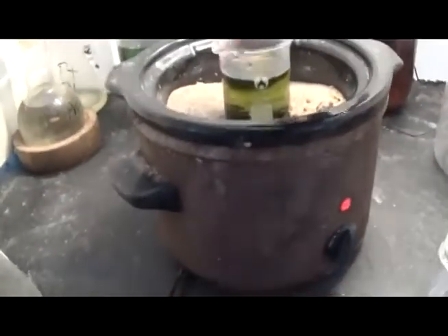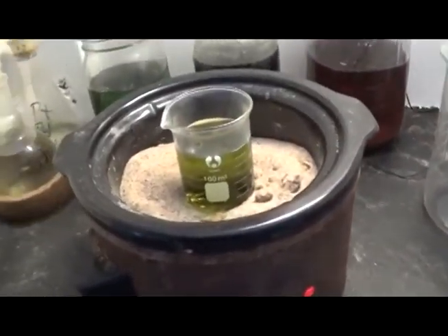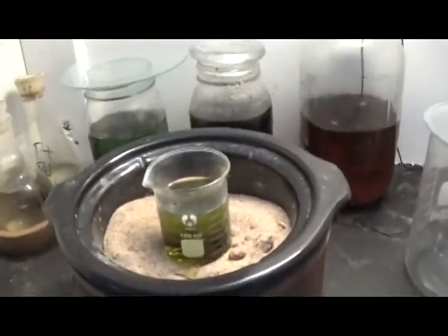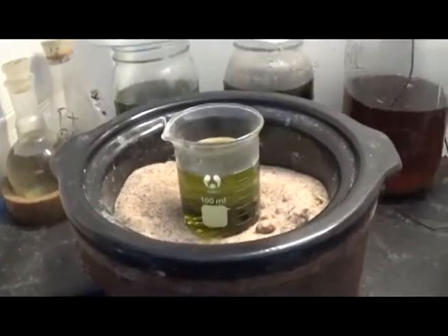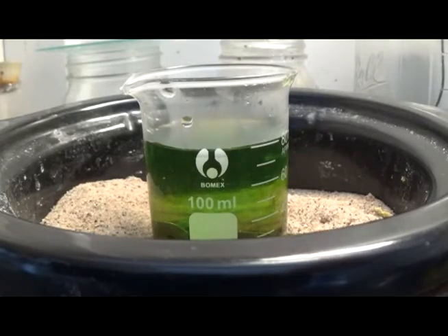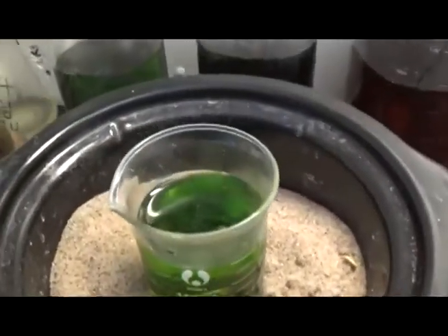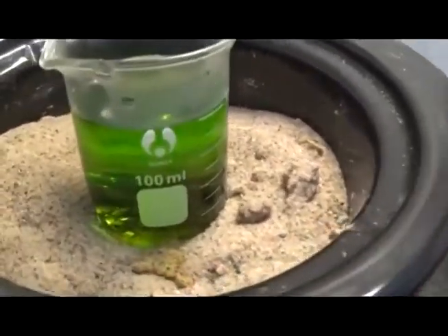Actually, a little bit of a promising start here — it does have my hopes up. I've already added about 3 ml of hydrogen peroxide, store bought. According to another YouTuber, it changed the oxidation state of the solution — that's what happens when it turns a different shade of green. Regardless of the reason why, you don't want to put too much of it in there because it will pull the gold into solution. You don't want that.